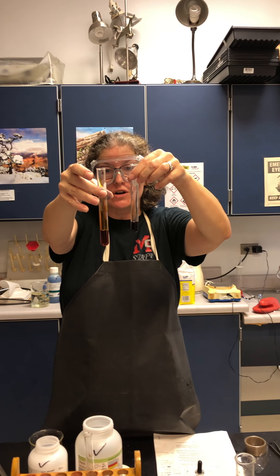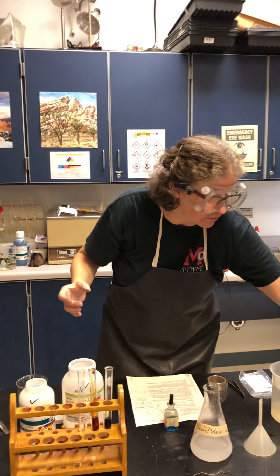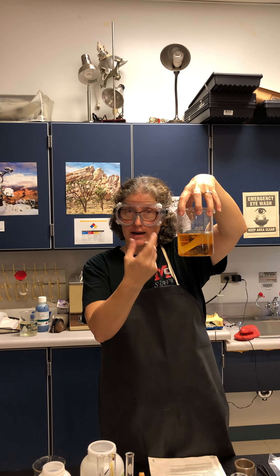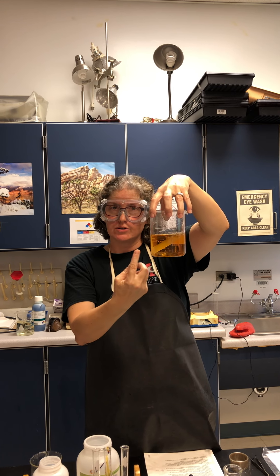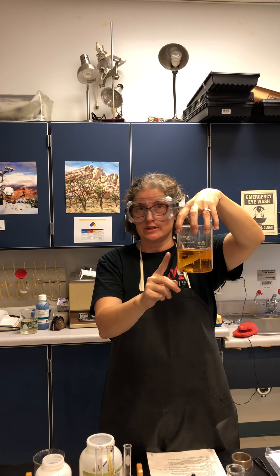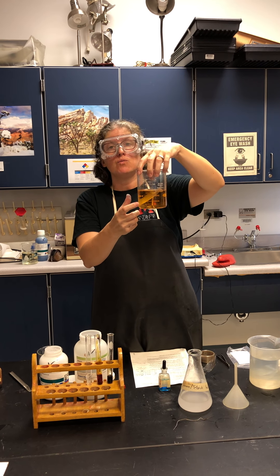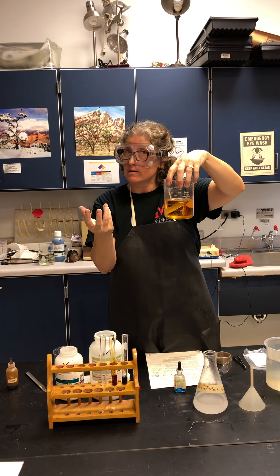So you should be predicting: if the starch is able to move out of the bag, if the pores allow it, what will the outside water turn to? That is your first question. The second question is, there's also glucose inside the bag — will the glucose be small enough to fit through the pores and come out into the beaker water?